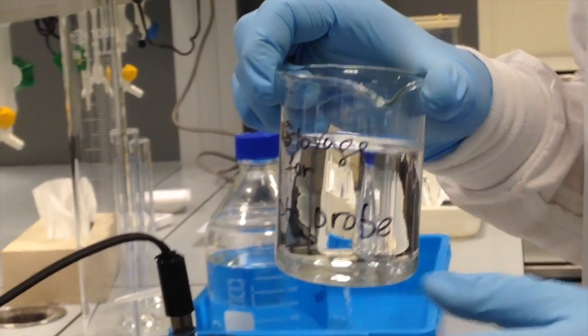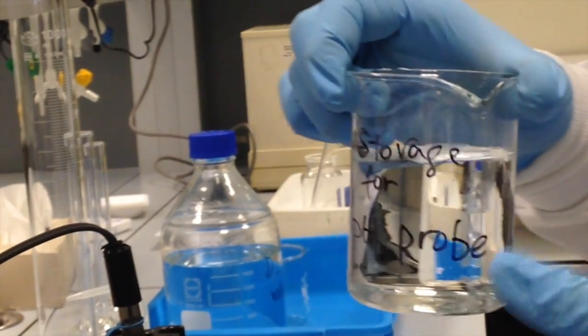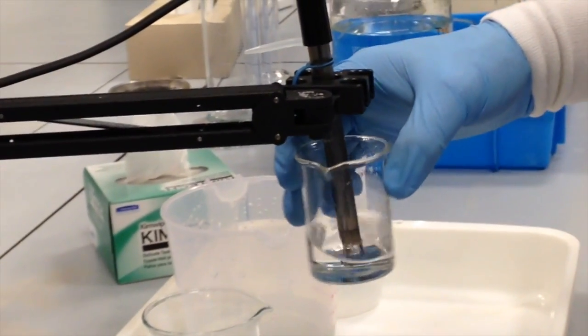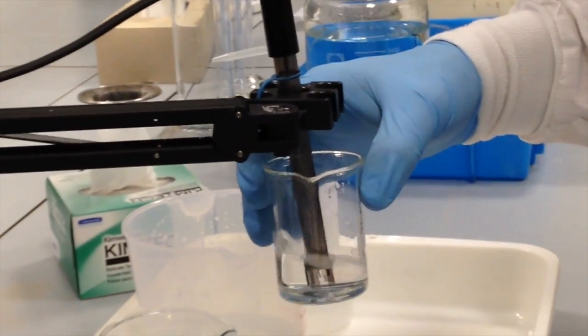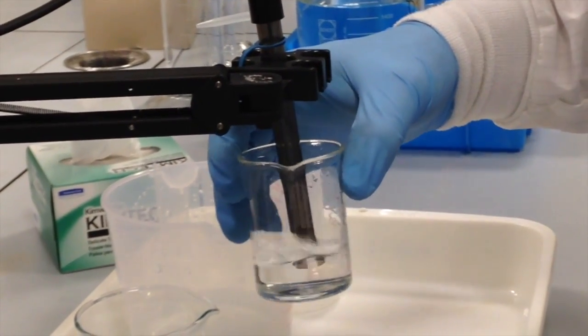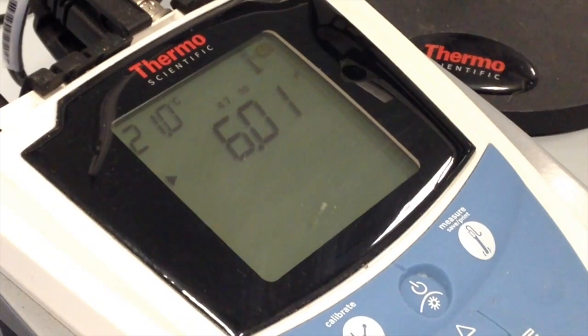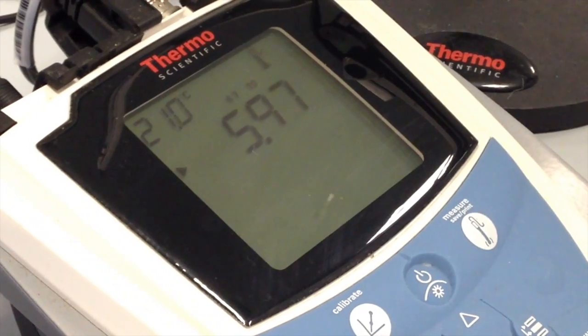And notice there is a liquid storage container where, when you're not using the probe, the bulb should be kept inside this solution so that it protects the integrity of the probe. But when I want to use it to take a reading from a sample, I can simply dip the probe into my sample and provide a little bit of swirling action. And I'm also careful to make sure that I'm not smashing the end of the bulb around. If you don't see anything happening on the instrument, there's nothing flashing or the numbers aren't moving, then you need to press the measure button to initiate the measuring function.